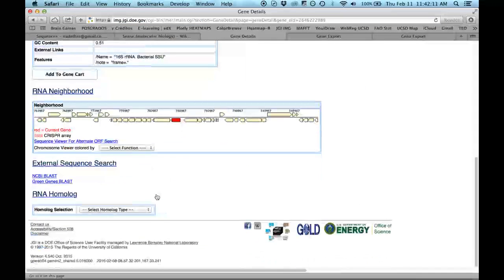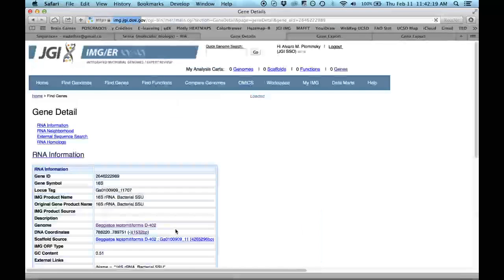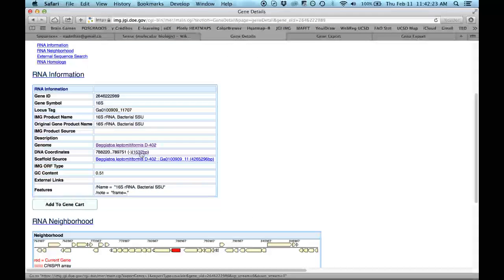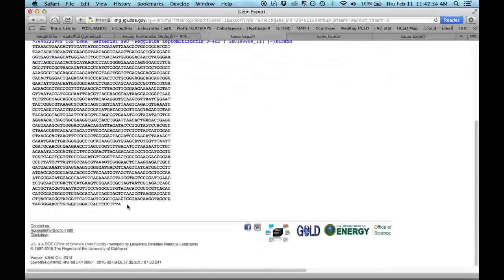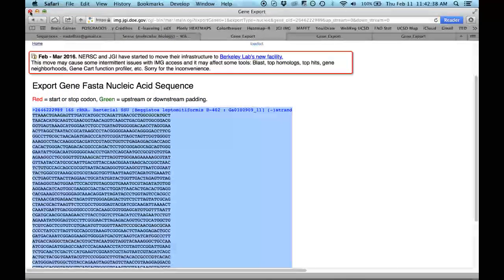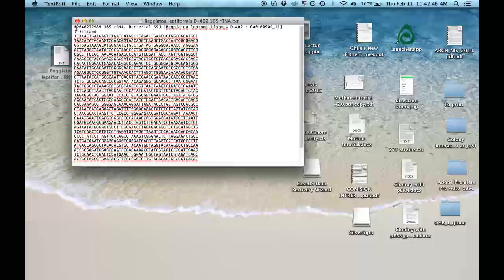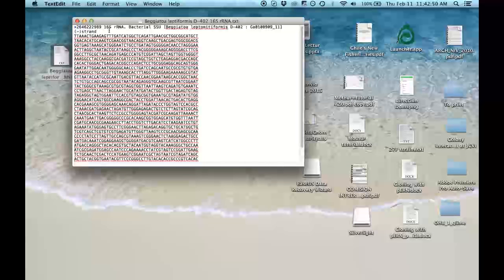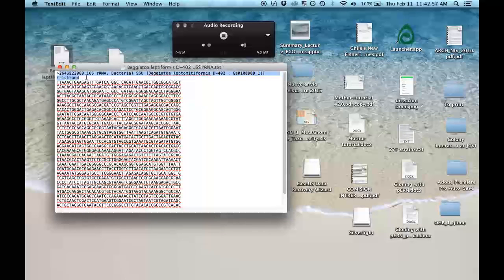You can go here, sorry, here. It's kind of tricky. You go and click here in the coordinates and it will show you the sequence. So here is the sequence. You just copy and paste it and put it in a text editor file, as I show you here. This is how it looks. You have this symbol here that means that it's a FASTA file. And here you can put the information or keep the same information that you have from the web page. The main importance here is that you know exactly what your sequence is from, and the length and the position, etc.